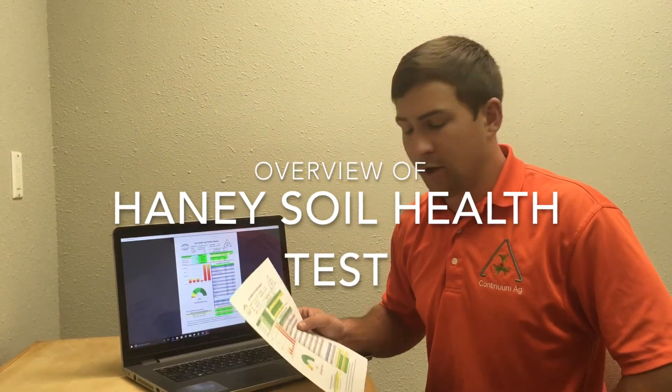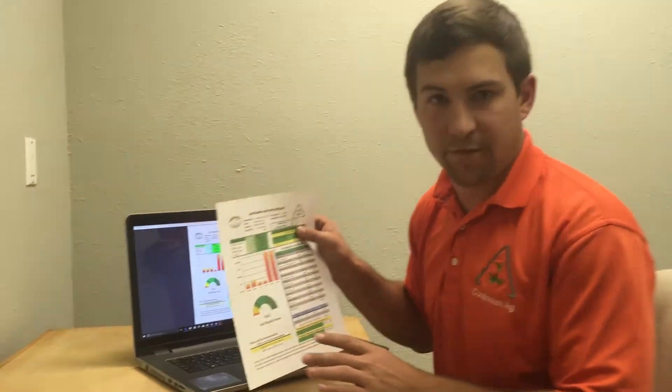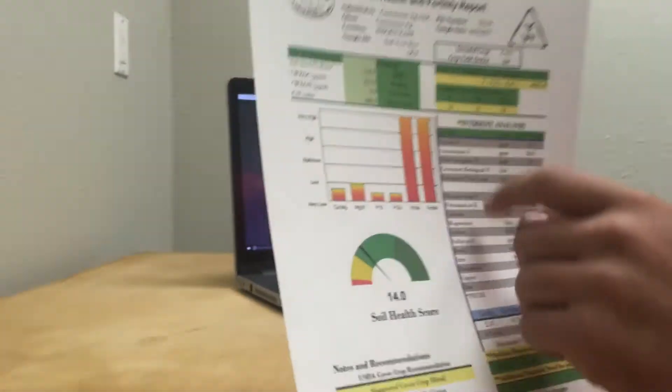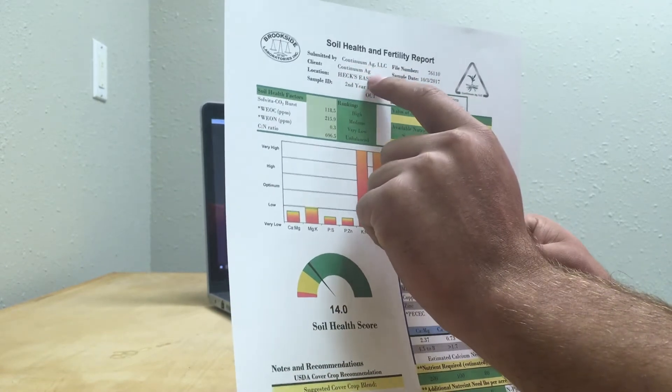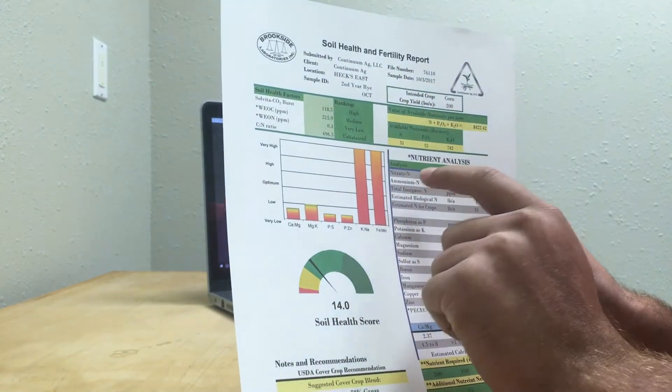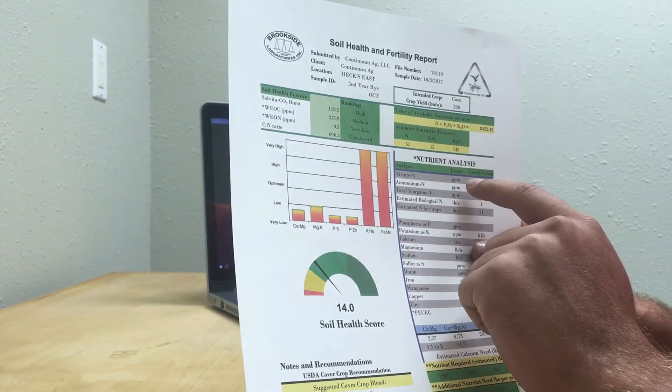Hi everyone, my name is Mitchell Hora with Continuumag. Today we're going to be looking through the Haney Soil Health Test coming back from Brookside Labs — just a quick overview of how to read the test and how to interpret it. When I get the test back from Brookside, I email it out to my growers. For today's purposes, I printed it off so we can more easily follow along. At the top it shows the company that submitted it, along with sample ID and sample location, which should correlate with any maps of the field that you have.